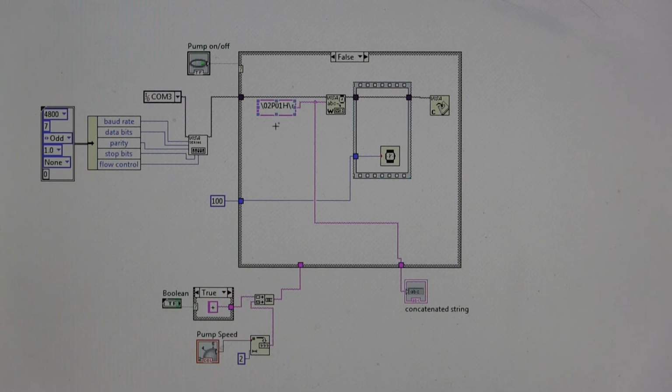Here we have another string that looks similar to what we saw in the initialize VI. Backslash 02 is again the beginning of the character. P01 is pump 01. H is the real salient command here. H is halt, and backslash R tells it to end the command. So halt is what we're sending, and it uses this VISA Write little program to actually send that halt to the pump. And again, we have a time delay and the close connection here.